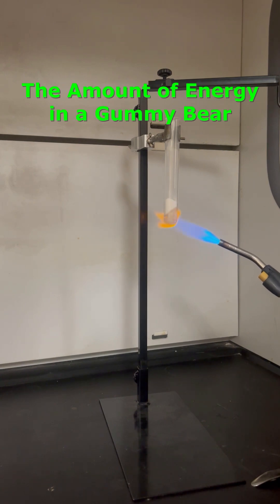In this oxygen-rich environment, sugar can ignite at a lower temperature and then burn much hotter and faster.